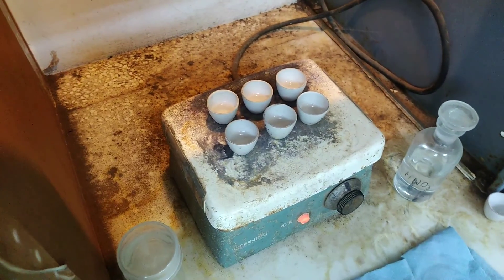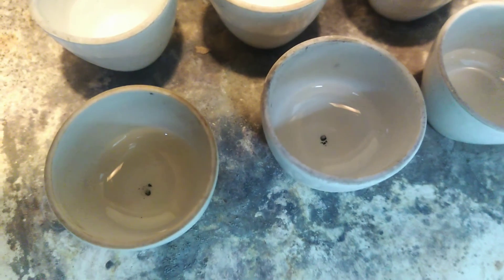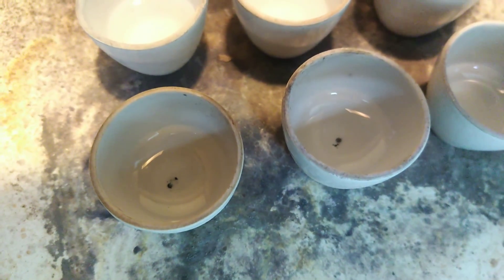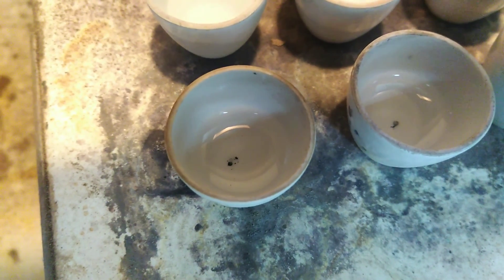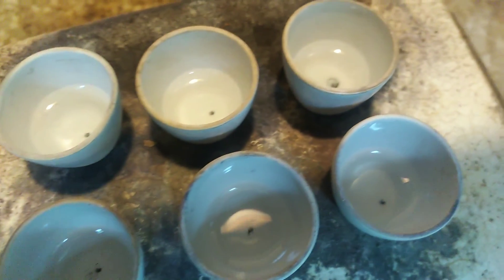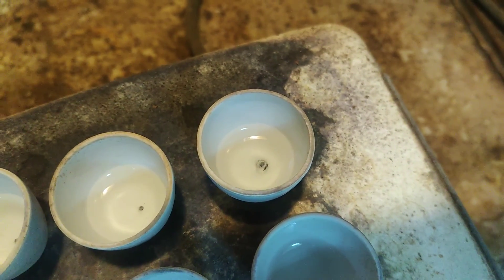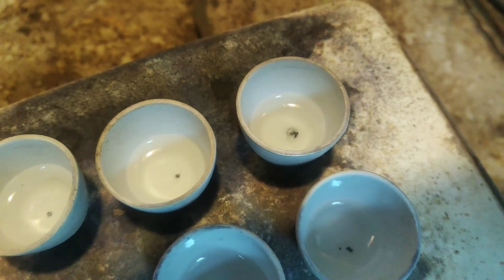The gold value is just whatever is left behind after the dissolution process is complete. You can see the beads are dancing around to the bottom of the crucibles as they're off-gassing. Sample number four was some hand-sorted vein material from another mine in New Mexico — that one seems to be pretty active. Sample number three, from down the decline, is the one I'm most hopeful for. That material has done decently in the past but is kind of spotty.